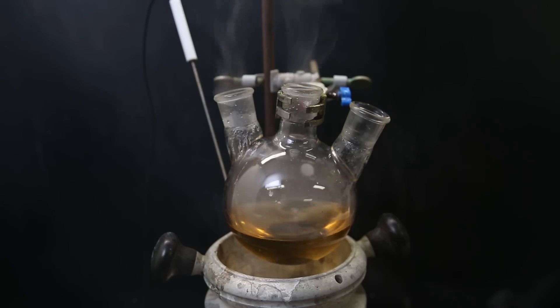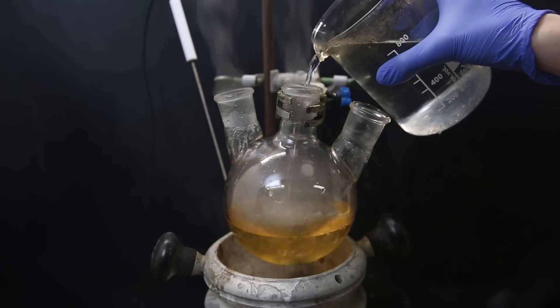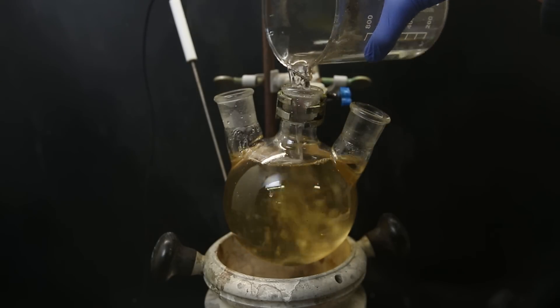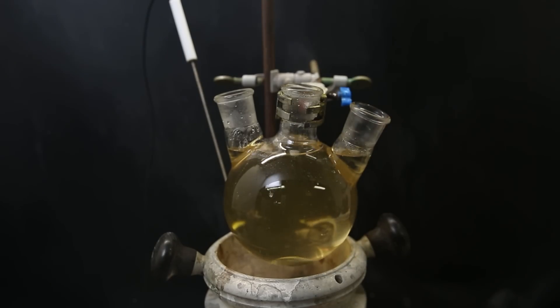I dismantled the setup, and the distilling flask is letting off a lot of vapors, including very irritating sulfur dioxide. So I cool it down and dilute it by adding a bunch of water, and I then poured it down the drain and washed it with more water, giving back my clean flask. So the reaction helped me to remove the tar, which is also why the solution was yellow. Note that it will still let off some irritating sulfur dioxide if you pour it, and sulfur dioxide is one of the worst, so have proper ventilation.